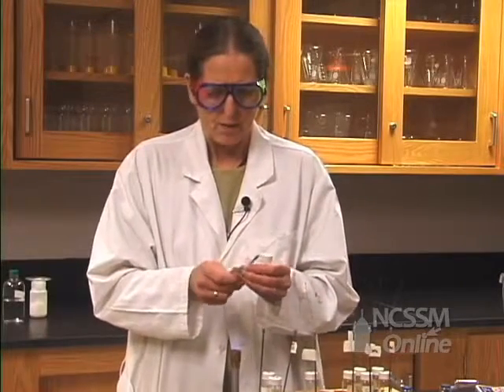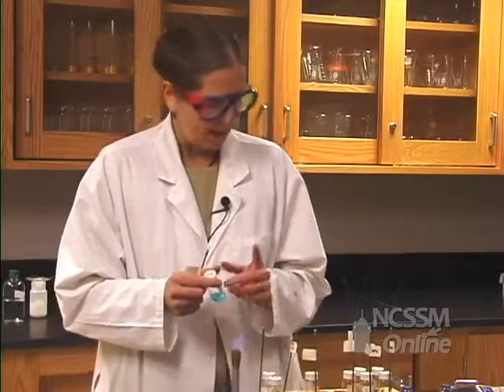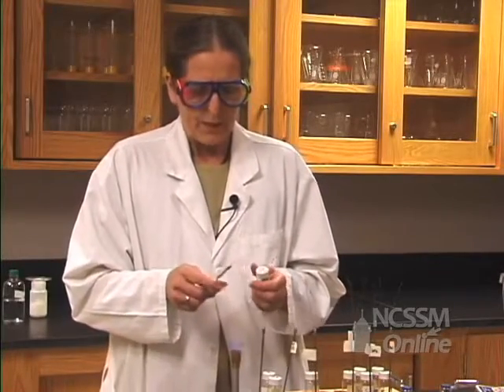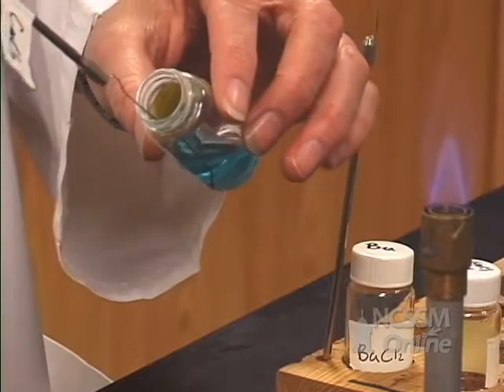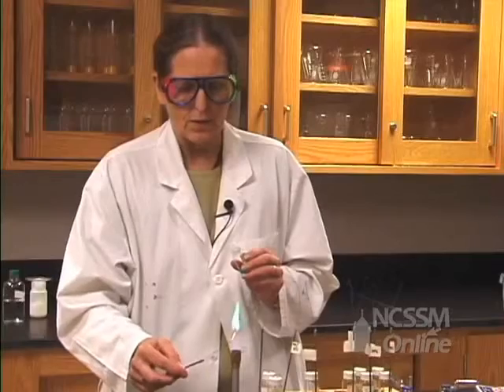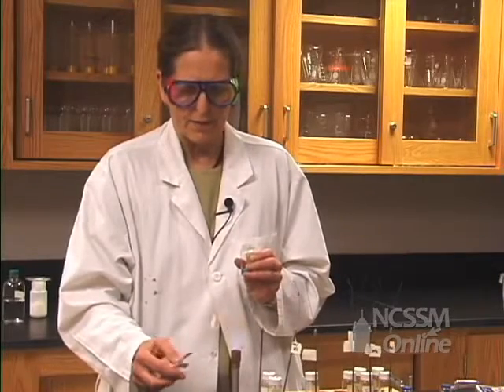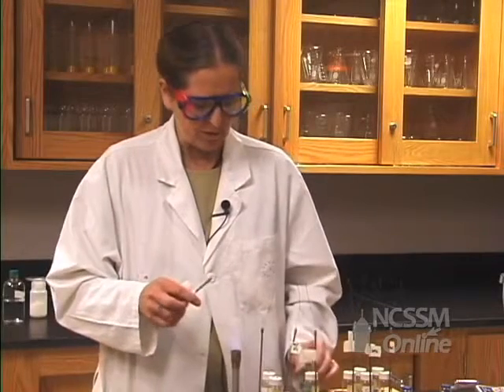We're going to do a flame test on a number of selected compounds, primarily group 1 and 2 ions. These are aqueous solutions and we have just an inert metal loop. We're going to dip the end into the solution and put it into the flame. That excitation characteristic color is like a fingerprint for an element. We're going to look at a number and then ask you to identify some unknowns.